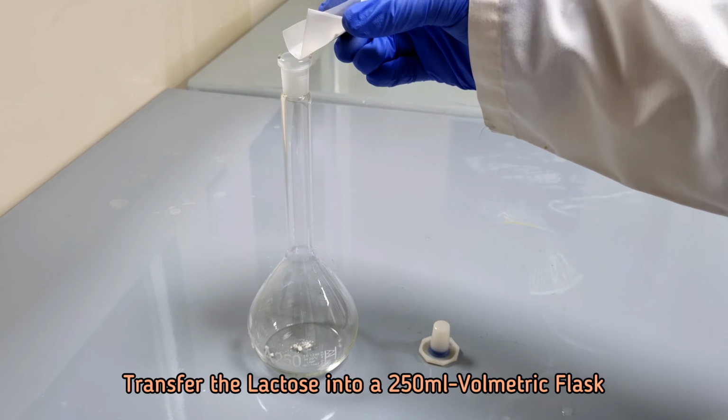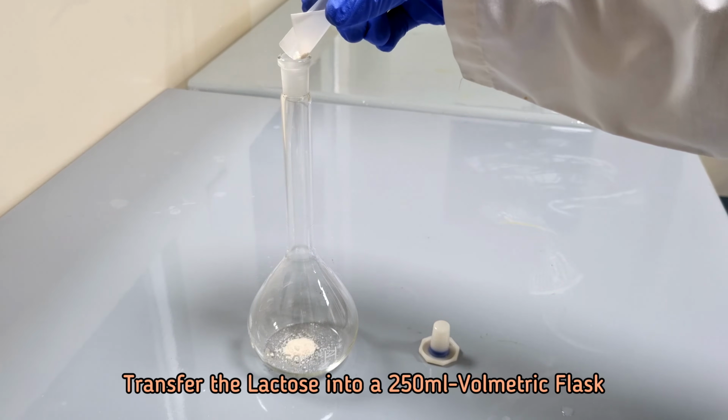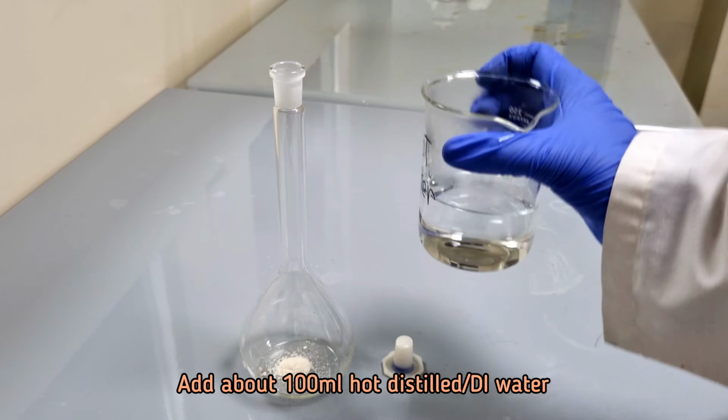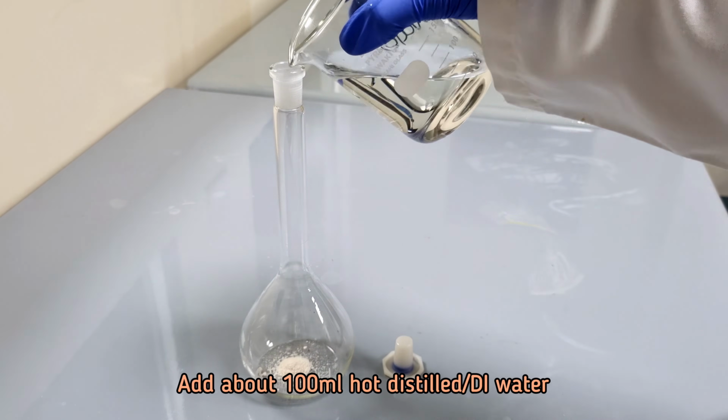Transfer the lactose into a 250 ml volumetric flask. Add about 100 ml hot distilled water and swirl to mix the content.